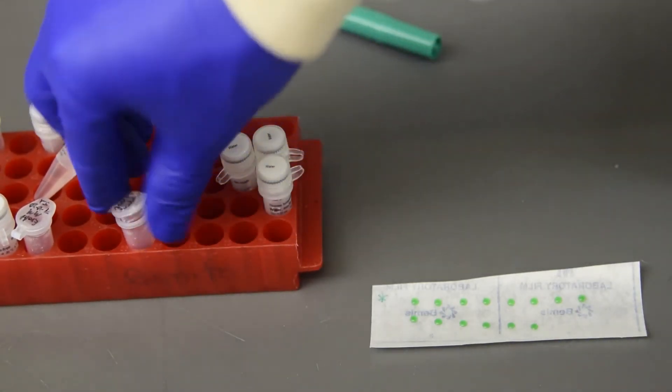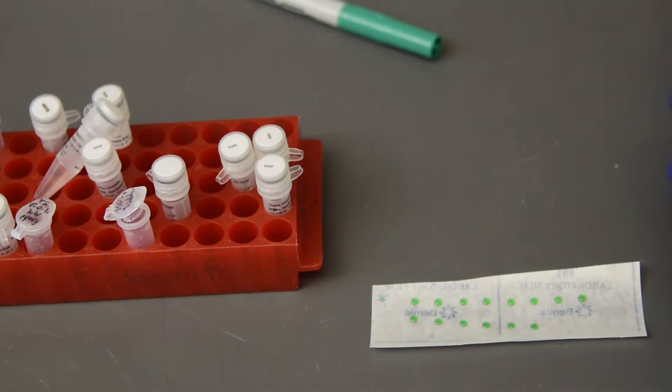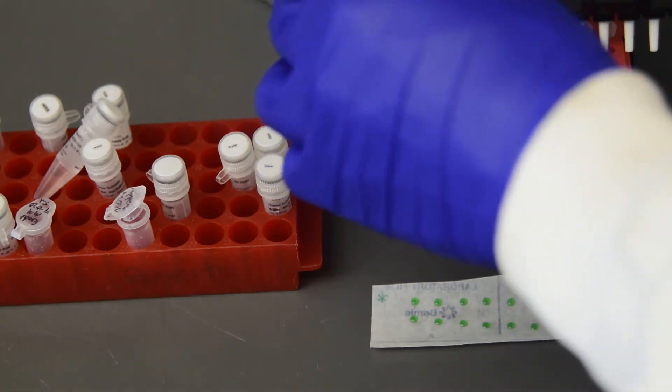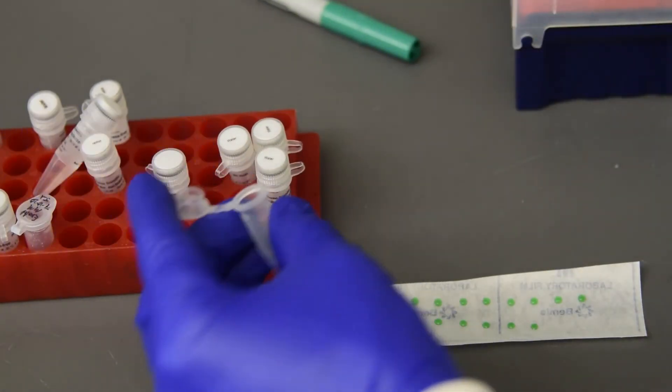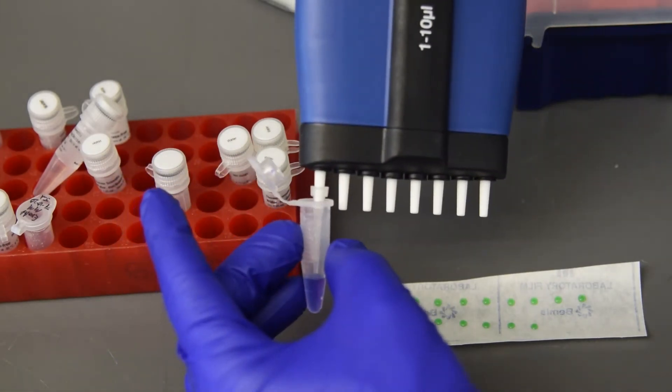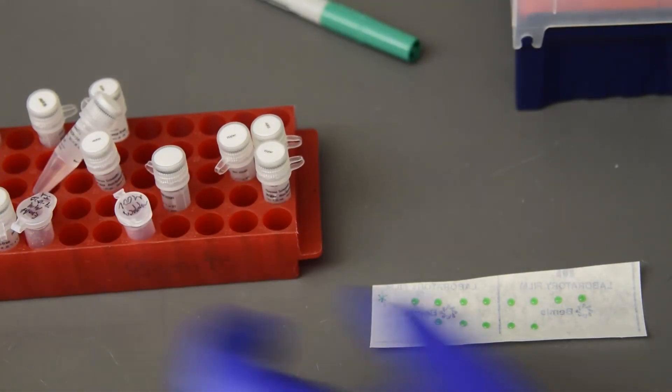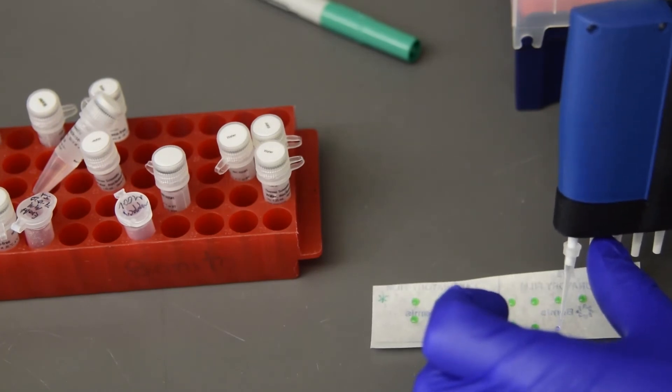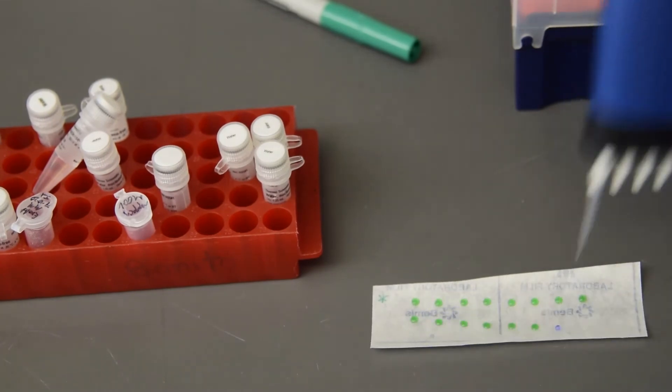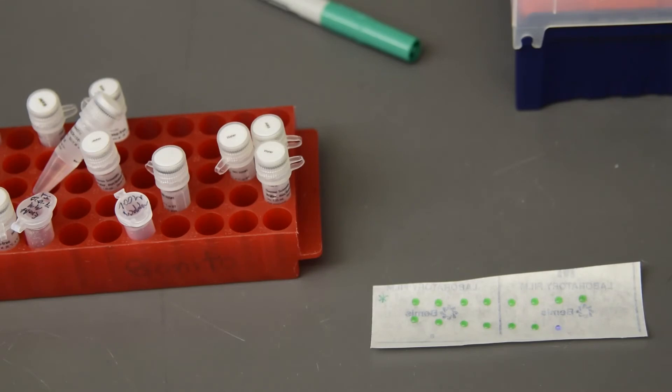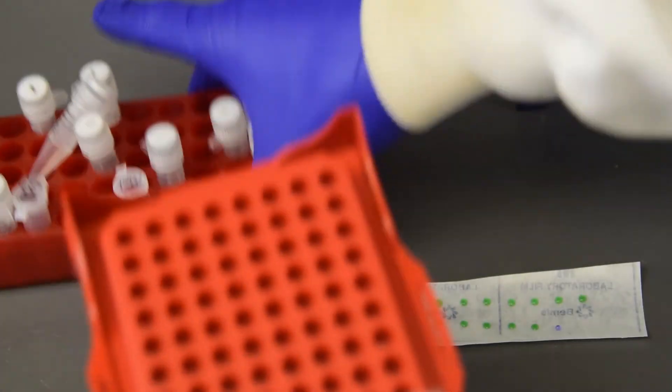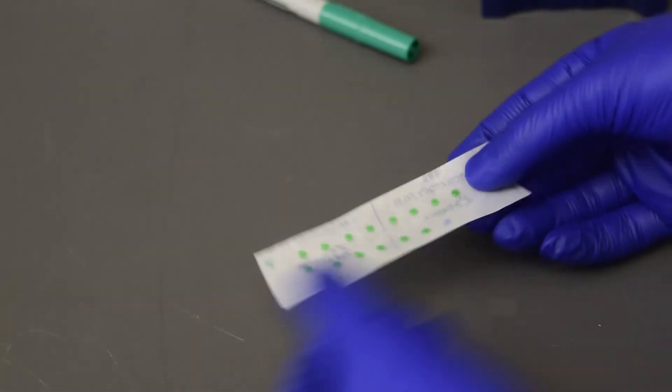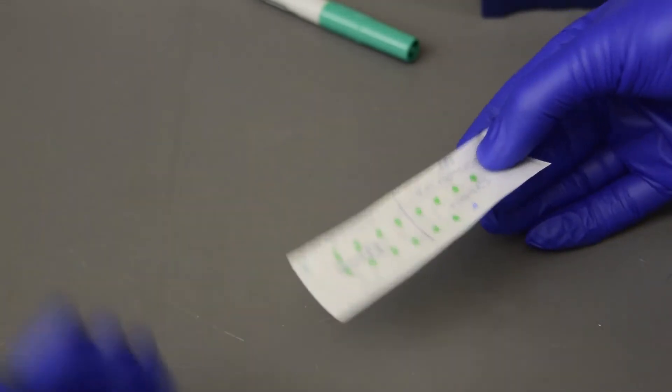Add the same amount of DNA ladder. Carry the PCR product to the gel room carefully, blocking the wind with your hand as you walk.